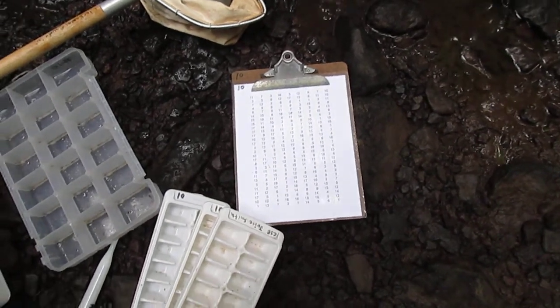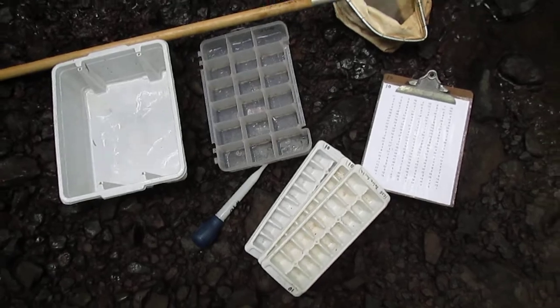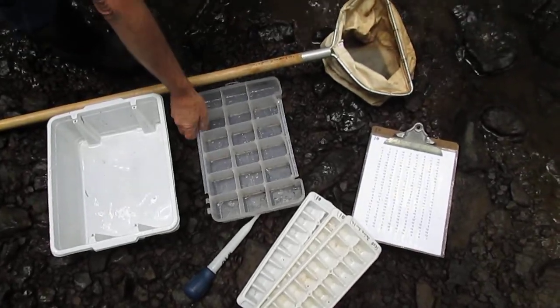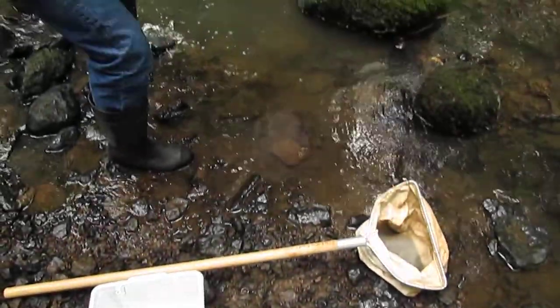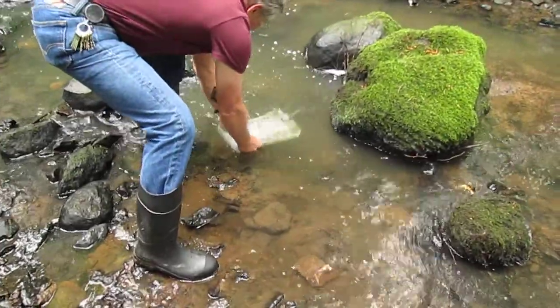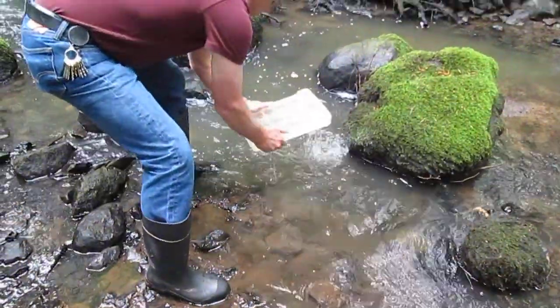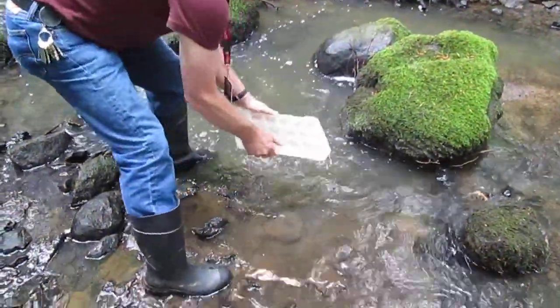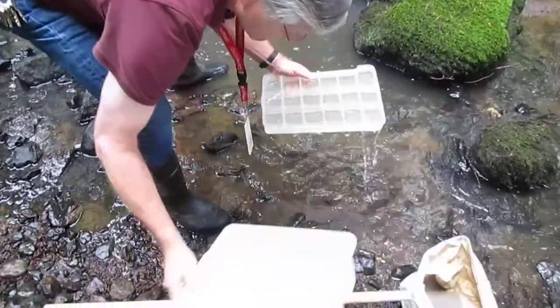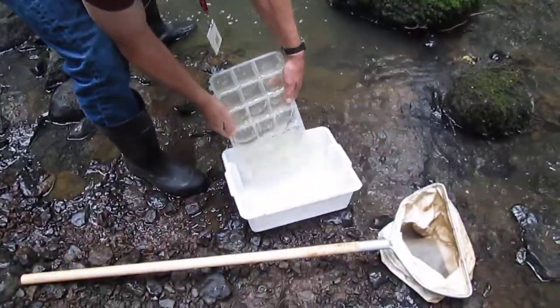To start with, the first step is to take the subsample tray and fill it with water. By filling it with water you know exactly how much will fit back into that tray. We are going to pour that into the white tub.